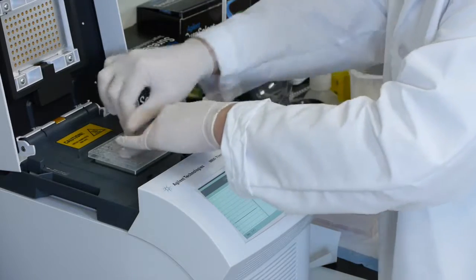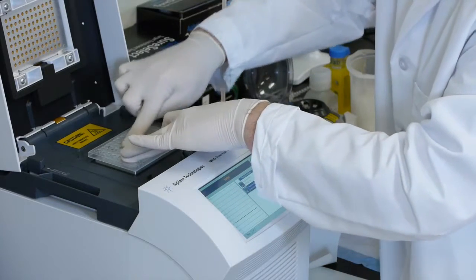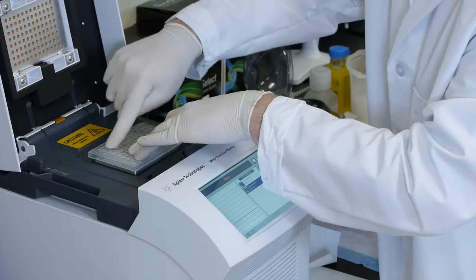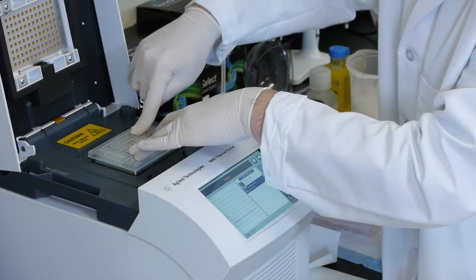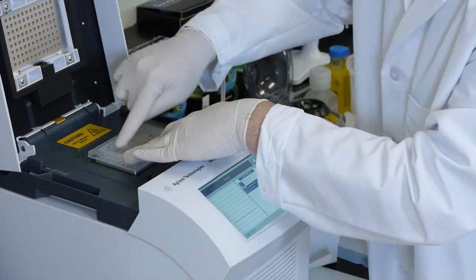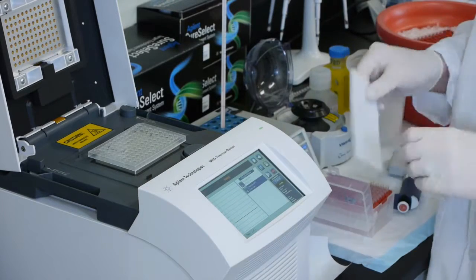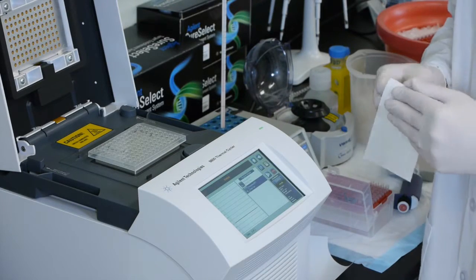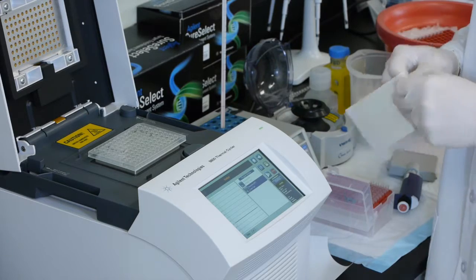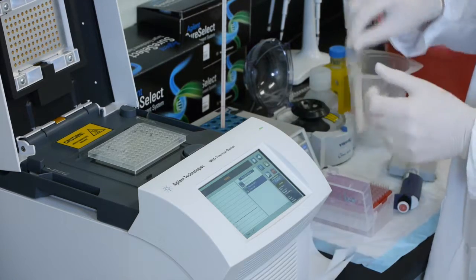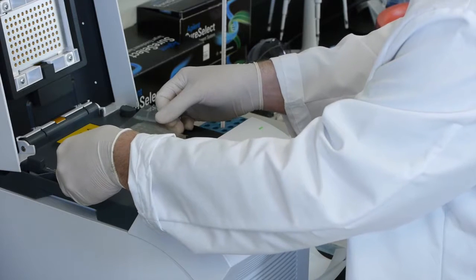Again, I'm very tightly sealing these wells, rubbing my fingertip over each of the wells to ensure we have a very tight seal. And then I'm putting on a second layer of the film to really help ensure we're getting a very nice tight compression with the lid to avoid any evaporation from occurring.